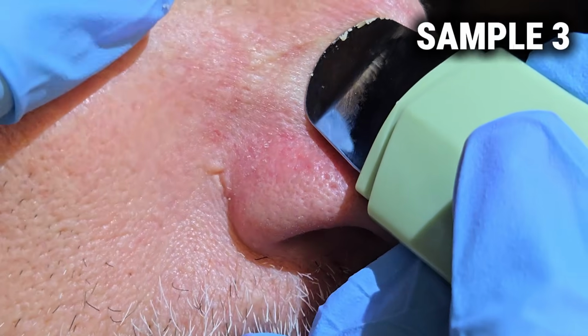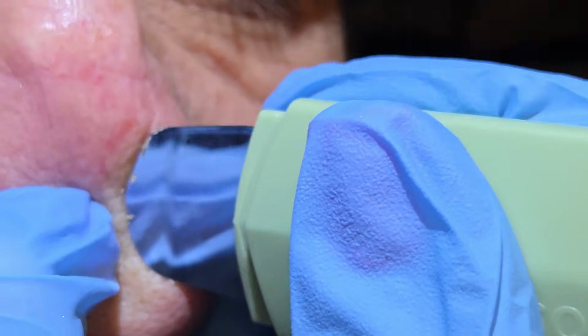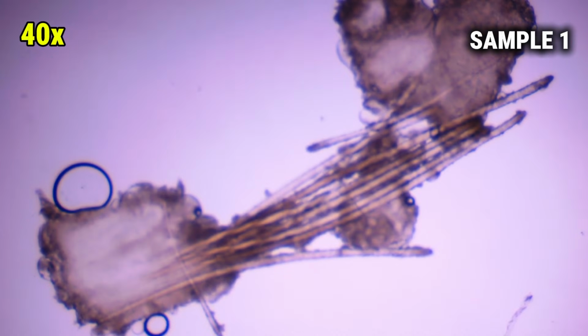As you can see, she's collecting samples from my nose right now. Trust me, I've got plenty more samples where that came from. And yes, if you'd like one or two, just let me know in the comments. Free shipping, of course. Ew, gross. Okay, you guys, let's get serious for once.